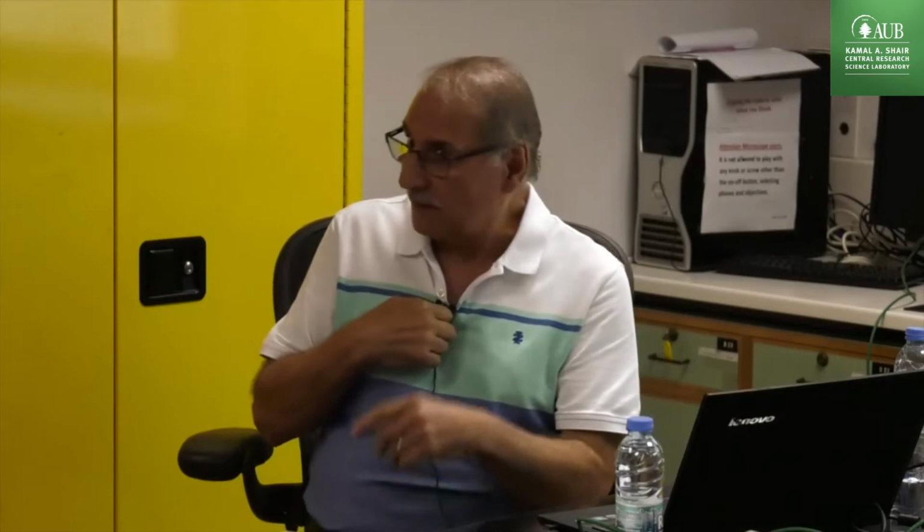Why? The BET is the total surface area of your sample. But what we have in our samples are micropores. I need to have the micropore surface area. Yesterday I also told you we have no way to measure the micropore surface area directly. Some people use the Langmuir surface area for the micropores, but Langmuir is more for chemisorption than physisorption. People don't like this one here.